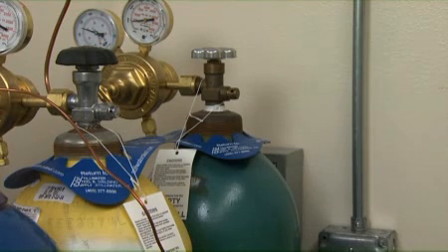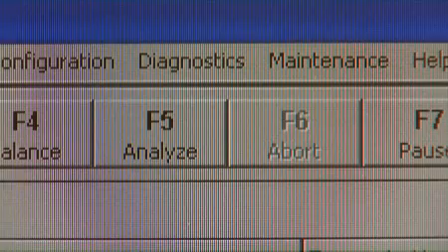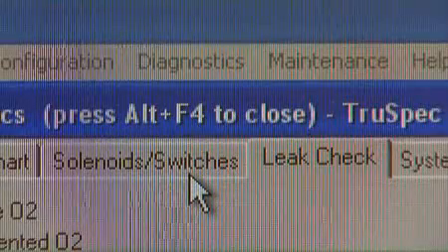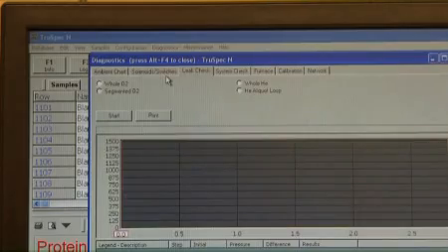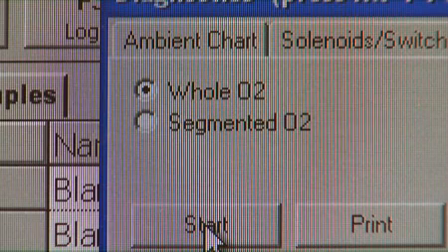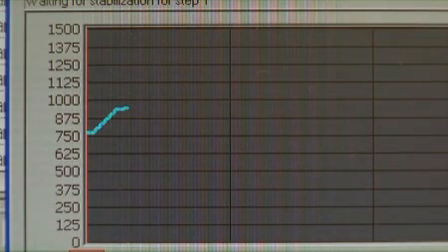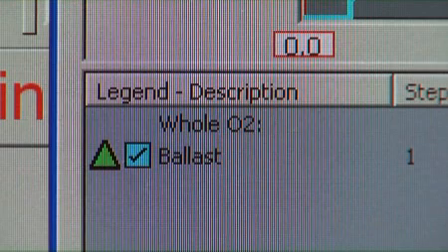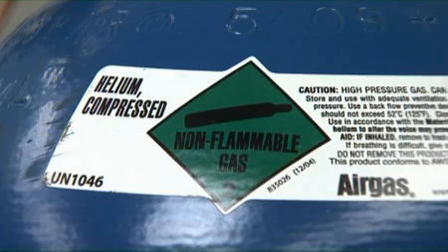Oxygen is the combustion gas. A whole O2 leak check simply means that every part of the LECO that carries or contains the pure oxygen gas will be checked for leaks. To perform the whole O2 leak check, go to the Diagnostics menu and select Leak Check. The leak check screen will appear. Click the whole O2 button at the top left portion of the screen. Click Start to perform the whole O2 leak check. System pressure is monitored in the chart in the middle of the screen. When the test is complete, the results column should indicate Passed. If the results column indicates Failed, there is an oxygen leak in the system and it must be located and repaired.